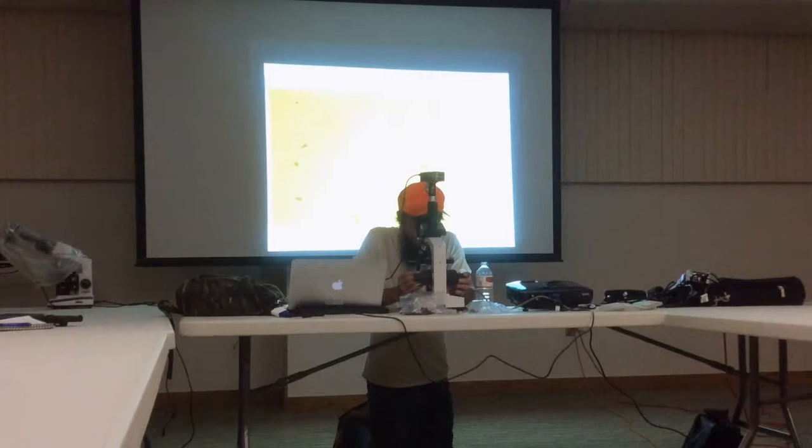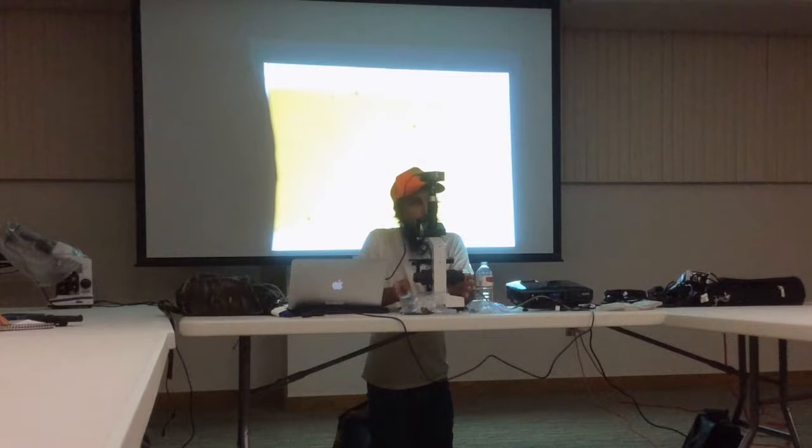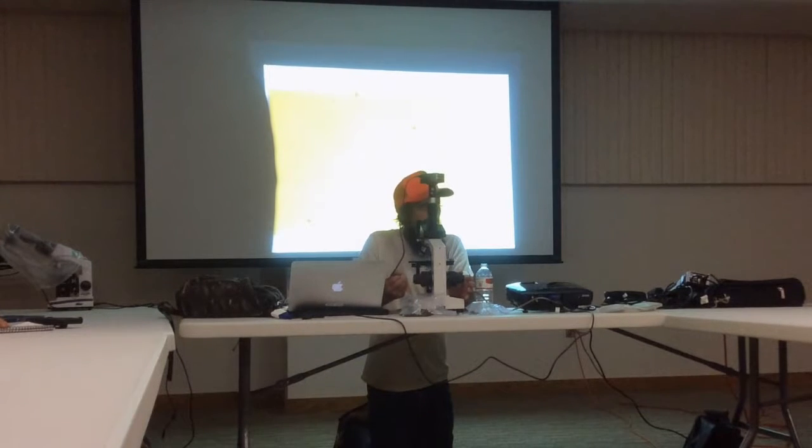So this is the IMO sample, and not nearly as exciting as the soil sample, I don't think, at least. But do you notice all these round things that I'm seeing? All these round things in here. What those are typically are fungal spores or spores of some sort, because this IMO is dry and they're in their hibernation form. So it's as if they're in an egg, in their hardened off state.